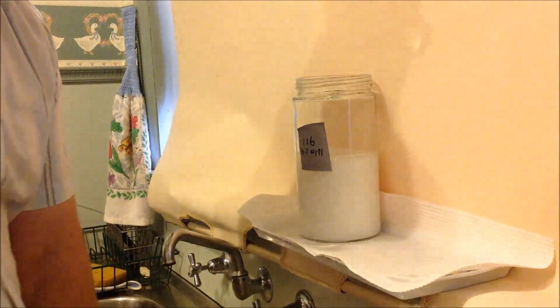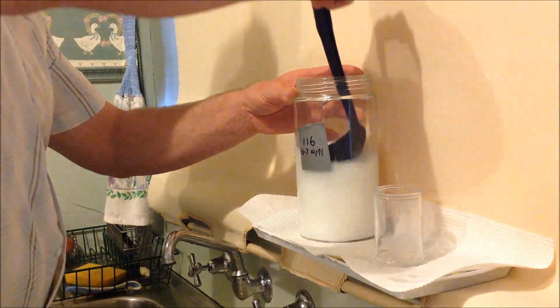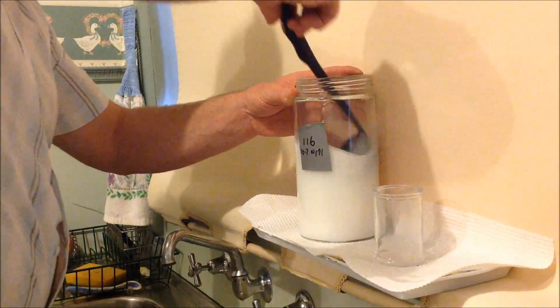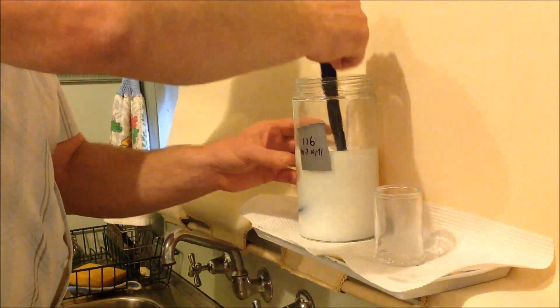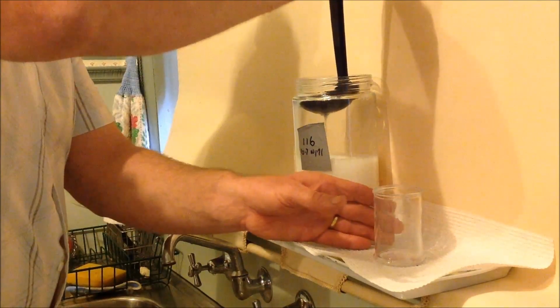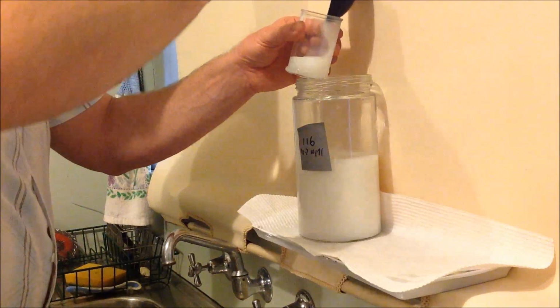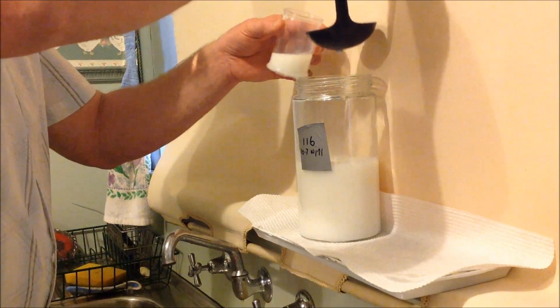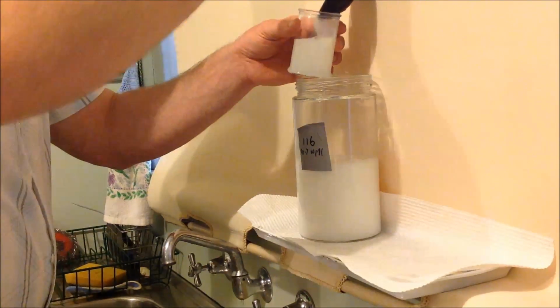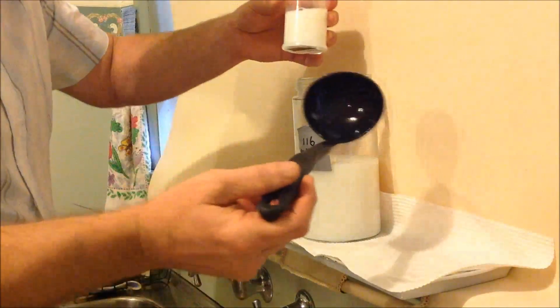So now I'll get some of that Ormus out and put it aside. Now you might have noticed that I avoid using anything metal, because of acids and bases and metal, and just introducing a variable into the equation. And also, people who are ingesting this stuff, it's important to keep everything away from metal. Apparently stainless steel is safe, but the stainless steel that you buy may not be safe.